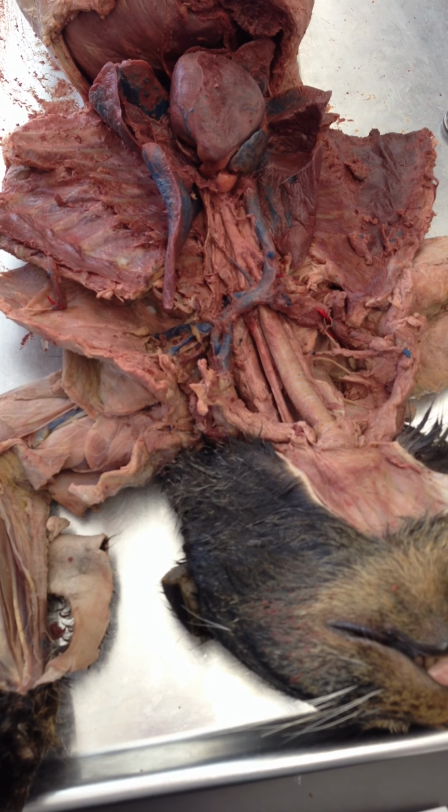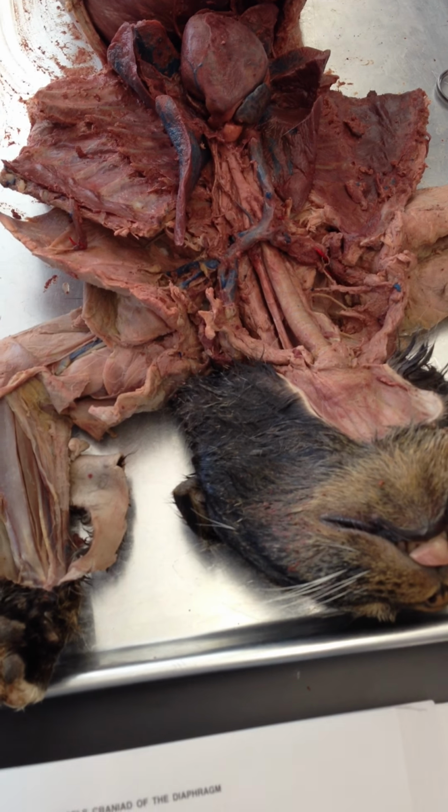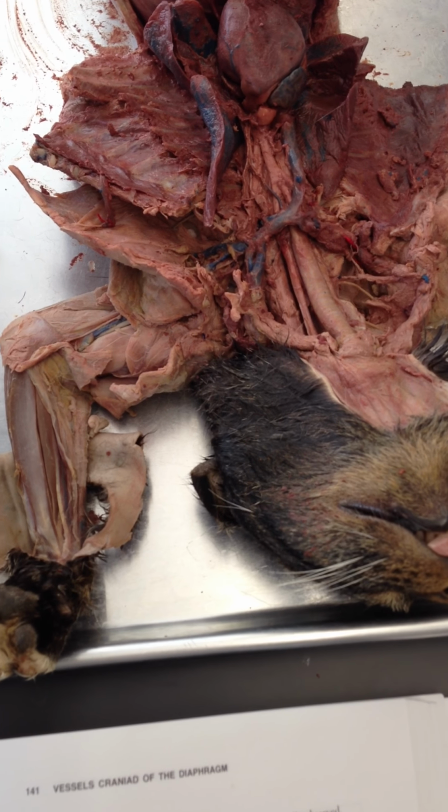That's good. Okay. All right, and now veins. You want to do those? Yeah, okay. We'll try those. You want to go through them first, and then you can reiterate?